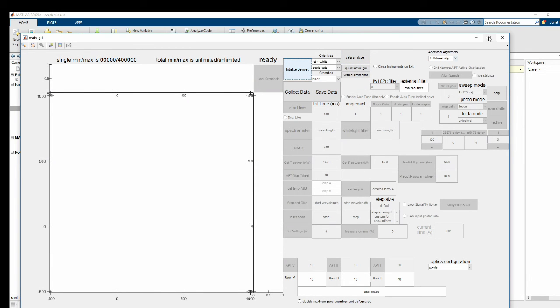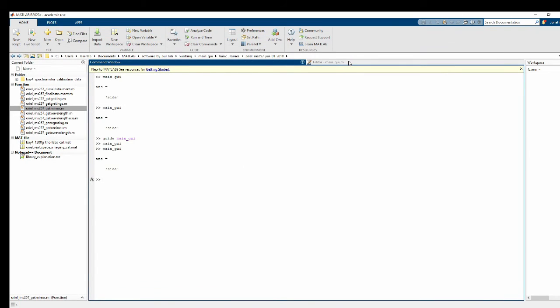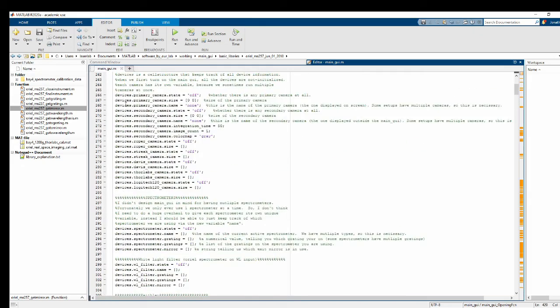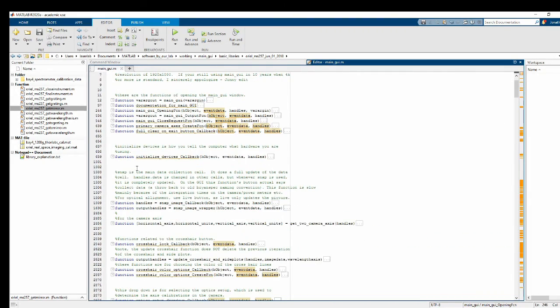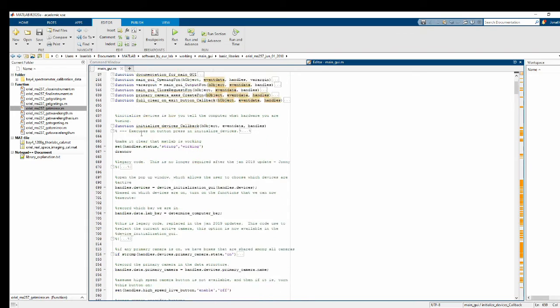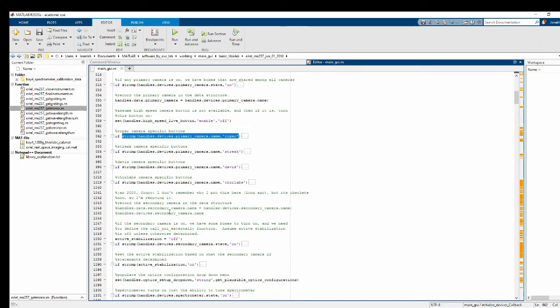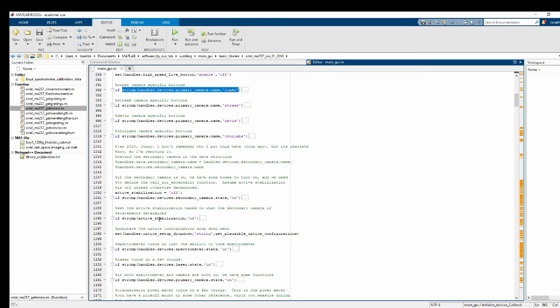it doesn't turn it on yet. So now we've got to make it so that when you initialize a device, if you initialize the white light filter, it turns these buttons on. So we go into the initialize devices call inside main GUI, which is here, right at the top. And somewhere in here, we're just going to add in this type of an if statement. If it's on, turn on the buttons. Now, I'll put it next to the spectrometer if I can. Okay, here's the spectrometer.